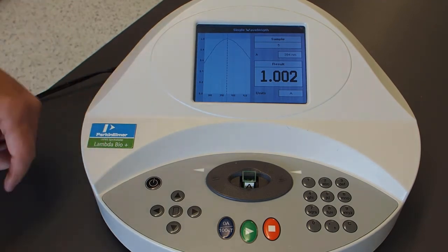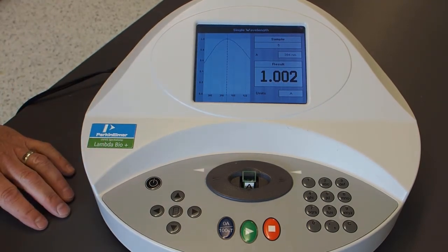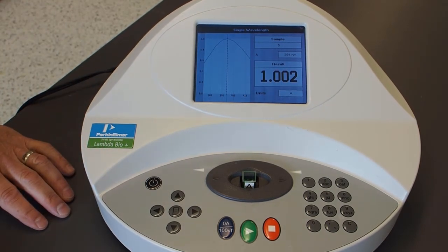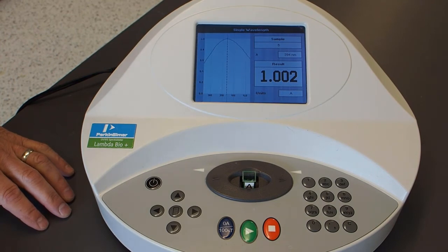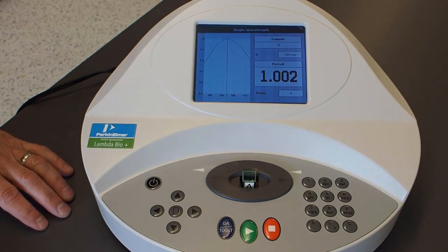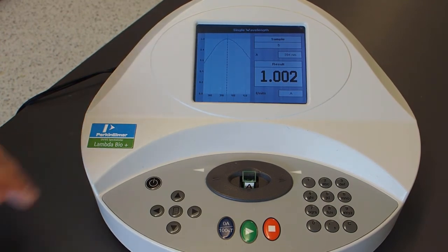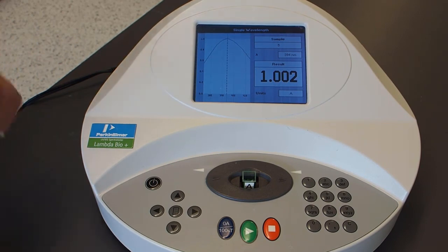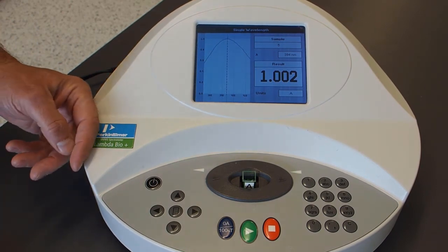We're done measuring our standard solutions. Now what we're going to do next is develop our standard curve using this information — the masses of the compounds — and work that out in Excel.